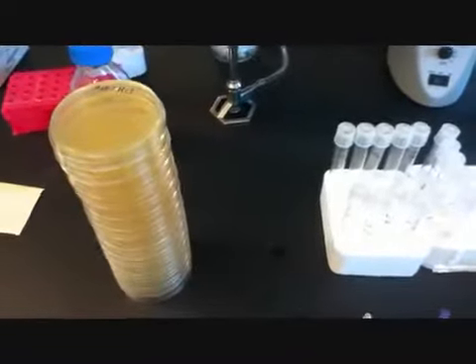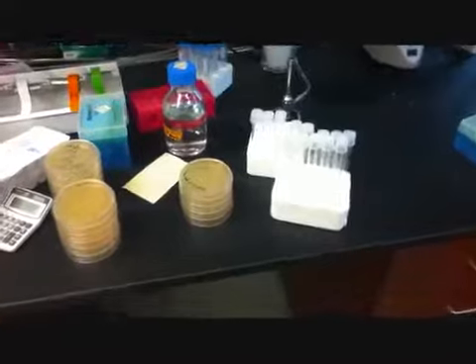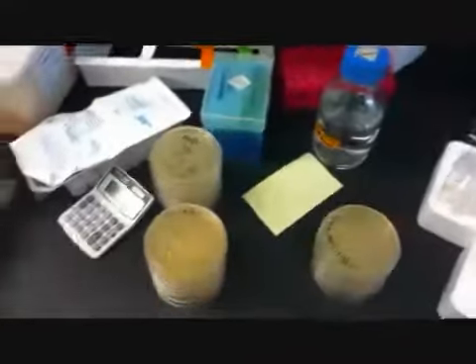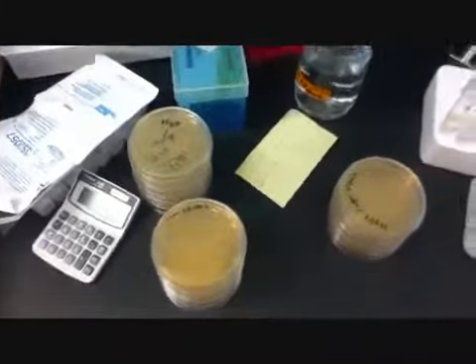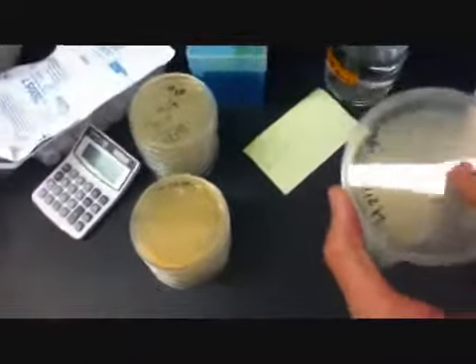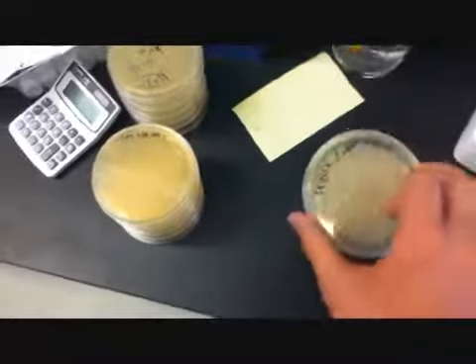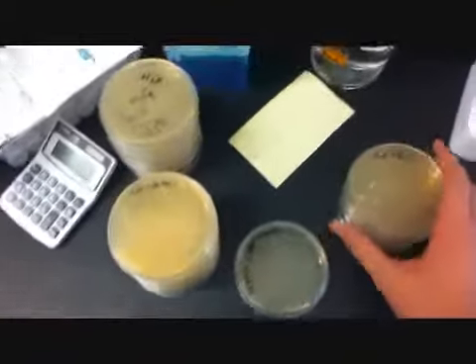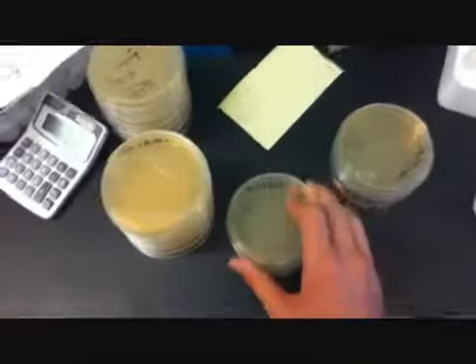The cultures are done. The plates are done. We're about to plate them and see how they grow. Okay, that took a while, but we managed. I'm going to go over what we have on the plates before we put these things away. We have H2O sugar HCl, that's 1x. H2O HCl, that's 1x.